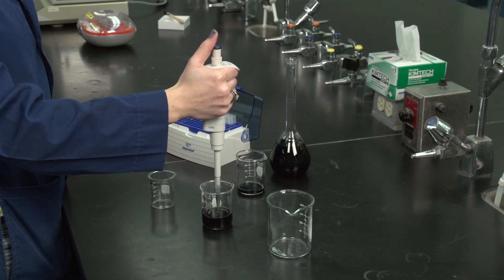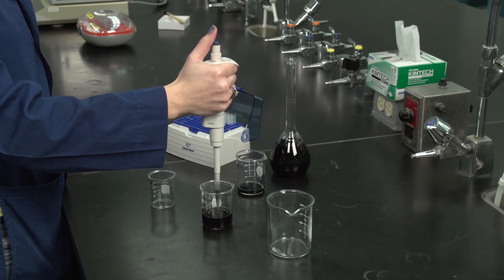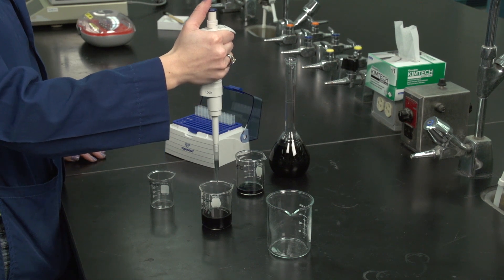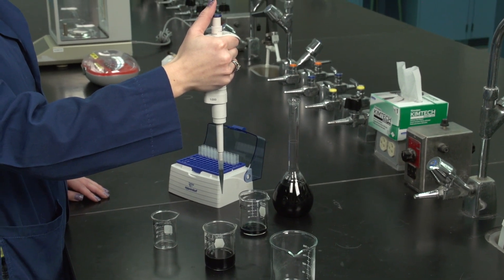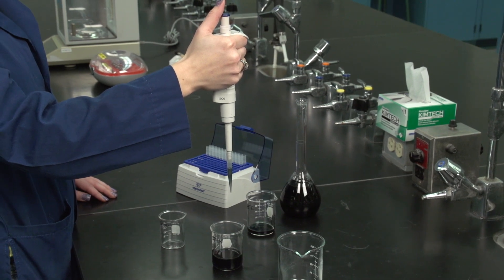Pause with the tip in the liquid for two to three seconds after drawing up the sample. Slowly withdraw the tip straight out from the sample solution. Do not touch the tip to the sides of the container.